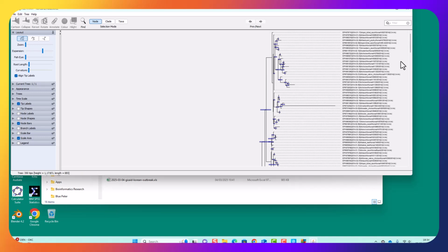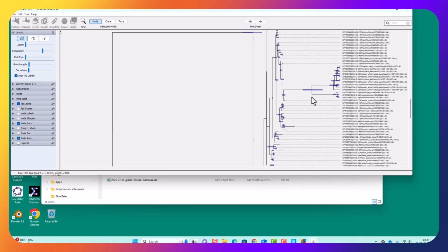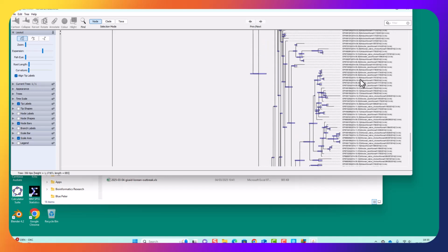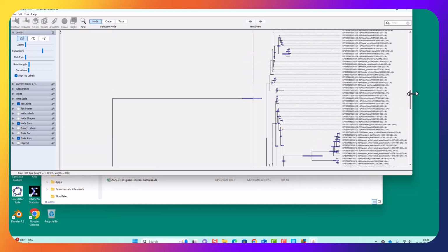There's some interesting long ones here where you've suddenly got some dramatic changes. Another one here where you've got a dramatic change. Here you've got some dramatic changes, and then there's a little cluster. So here these ones are all from Korea, and in ducks. Well, no, these are ducks, these are geese. So it doesn't look like that cluster is dependent on species. And then there's this other cluster here that continued. So there seems to be a strange set of subpopulations.